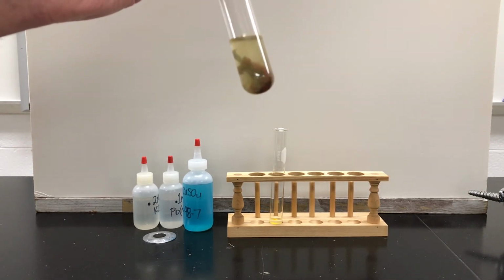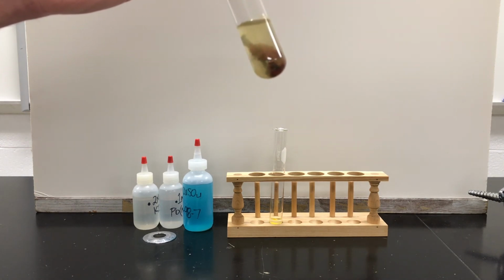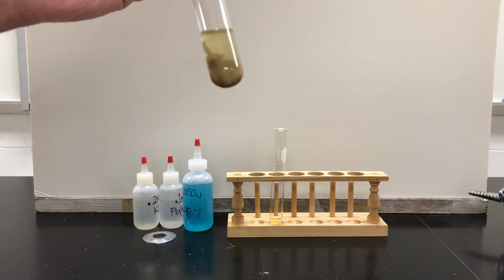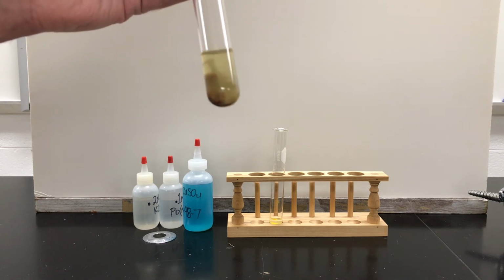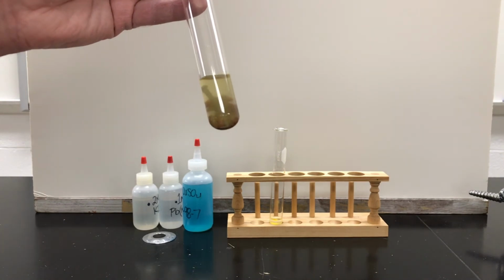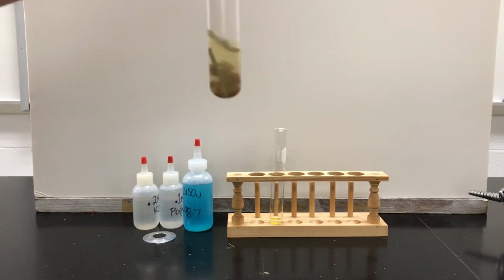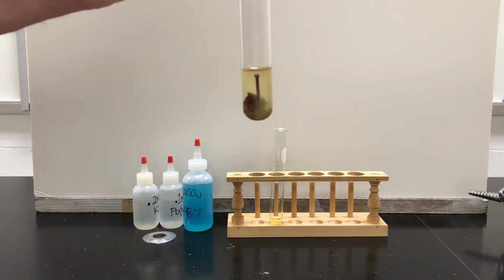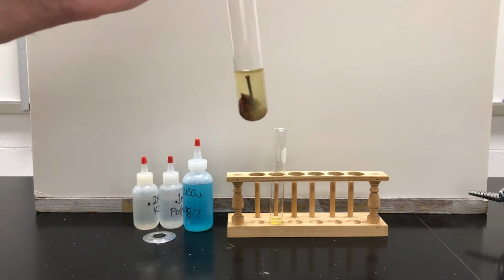And that material is copper. That's copper metal. It doesn't look like copper. Some people say it's rust, but that's copper metal. And floating around in the water now, and you can't see it, is iron. The copper from the copper sulfate and the iron from the nail have kind of switched places. The nail's still there. It's a little beat up, but a good portion of it's still in there. But it's not going to react anymore because we used all the copper.